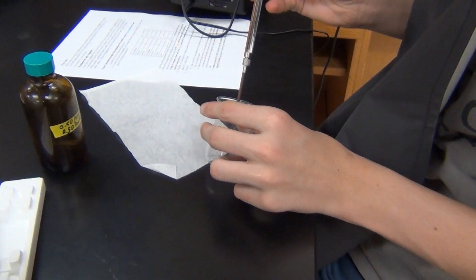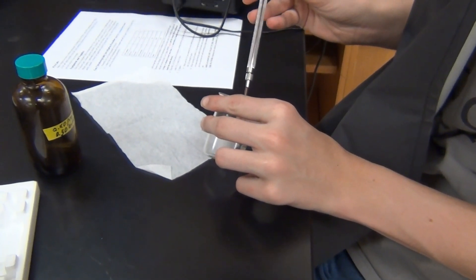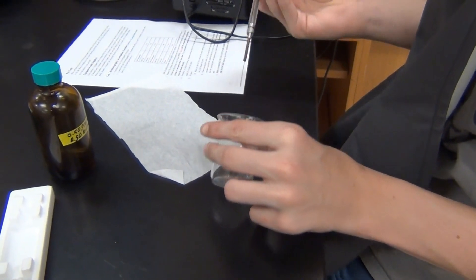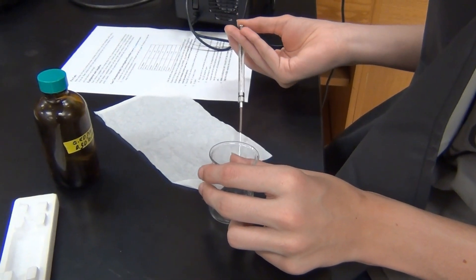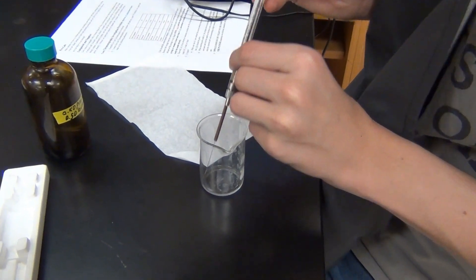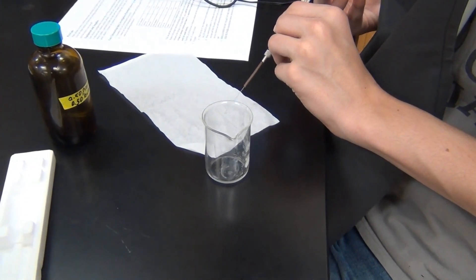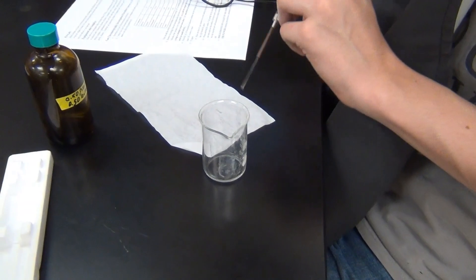Along with rinsing the syringe with acetone between samples, we are actually rinsing the syringe itself with the sample to make sure that there's not any acetone left in the syringe either, so we know that all we are injecting is pure sample.